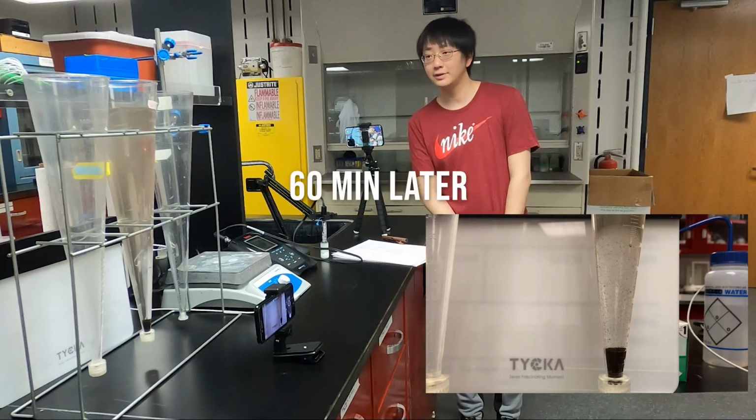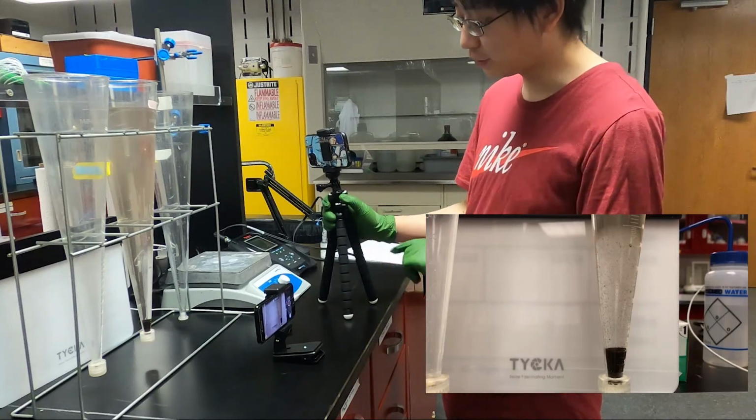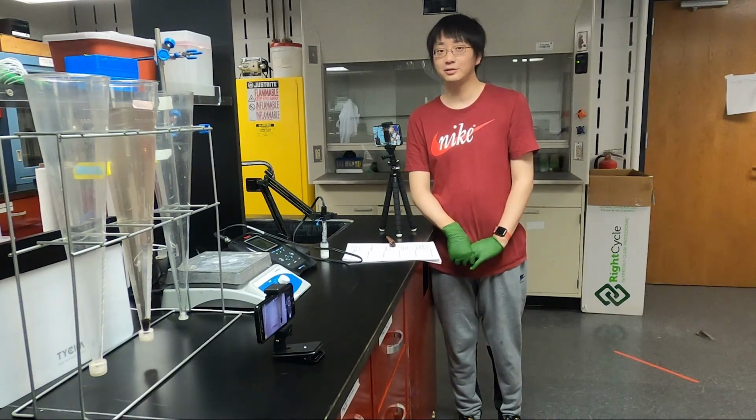So now it is after 1 hour, and then we can get the reading of the column. And we can see this is 2 milliliters. So that's all for the SolidsLab today. Thank you very much.